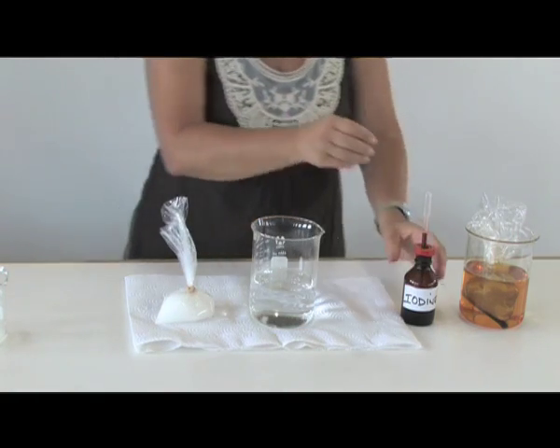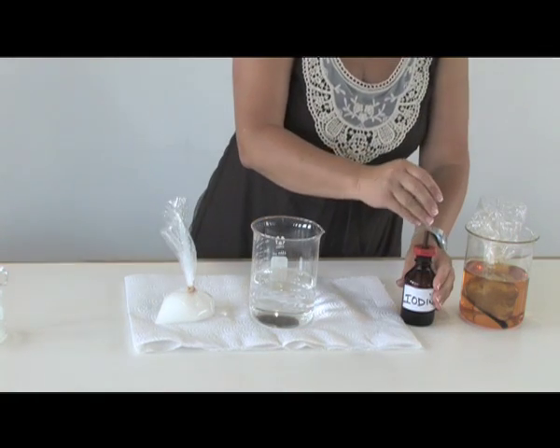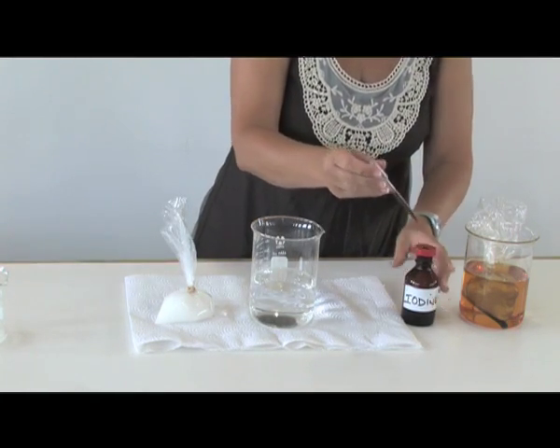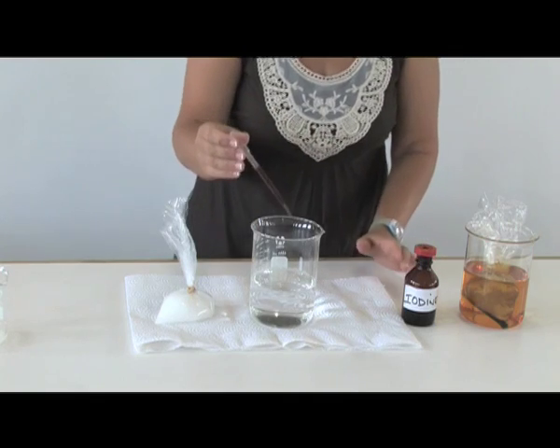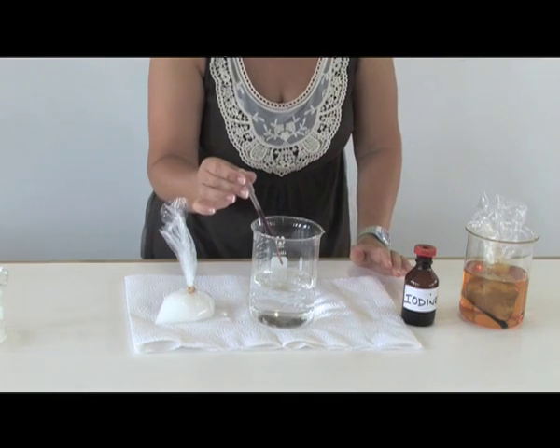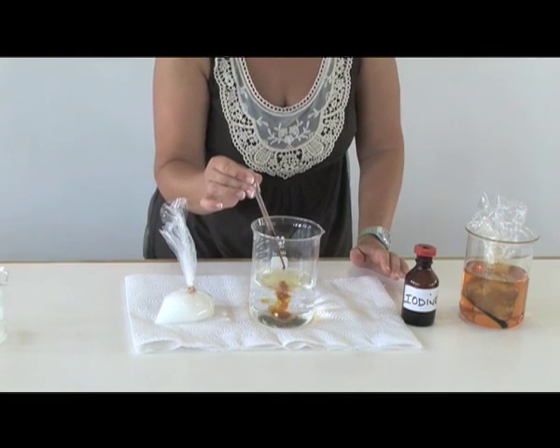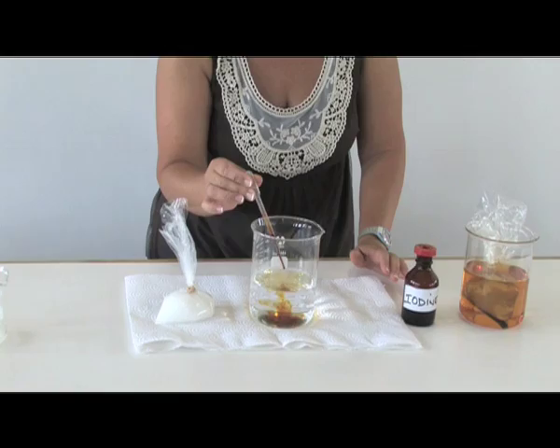What I am going to do is place about 20 drops of iodine solution into the water that is in the beaker.